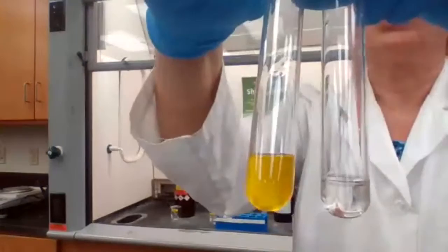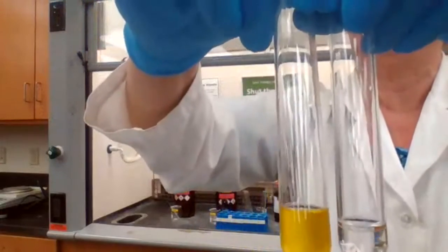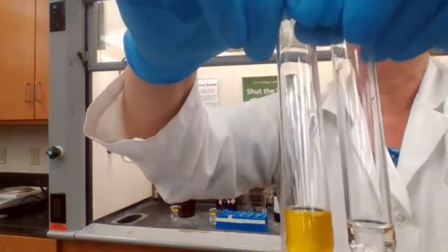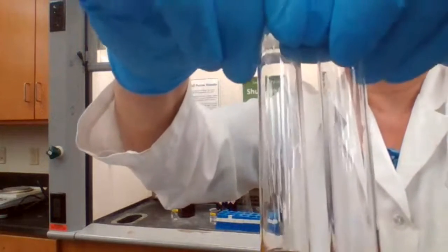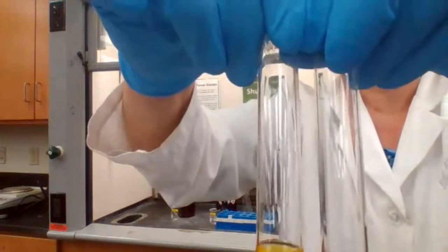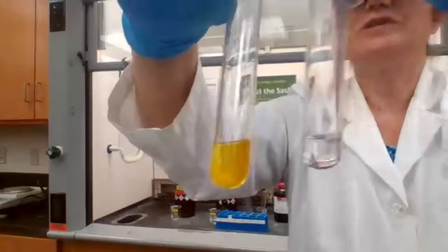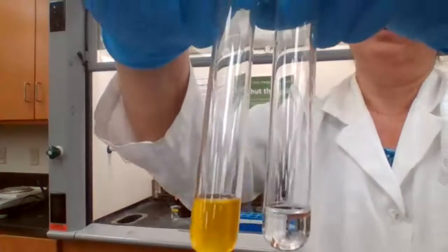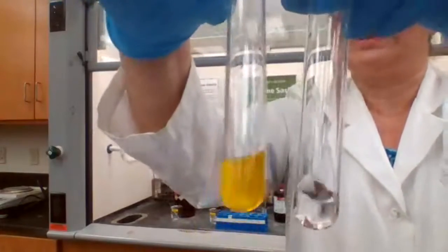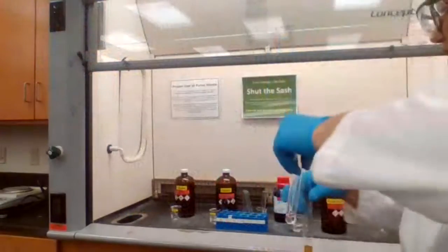The lab manual says 2-pentene, but what we have in the fume hood now is 1-pentene. The idea is not which pentene, the idea is to have an unsaturated hydrocarbon. Any unsaturated hydrocarbon, even the 2-pentene, is going to give you the same evidence. So if you take the screenshot of this, it's going to help you when you are identifying your unknown, how it's going to look like. That's by comparison. So you could see the difference for unsaturated and for saturated hydrocarbon.